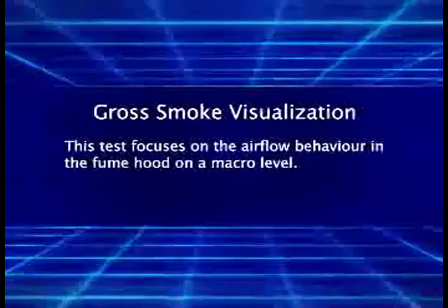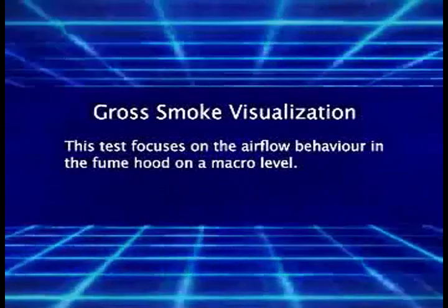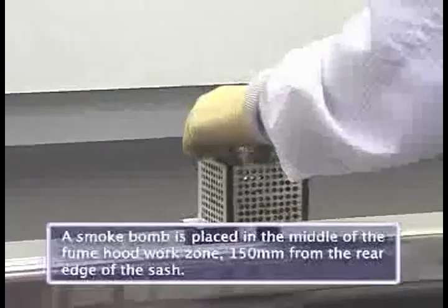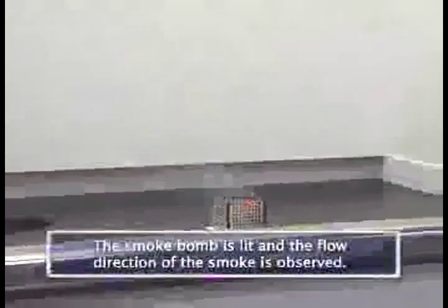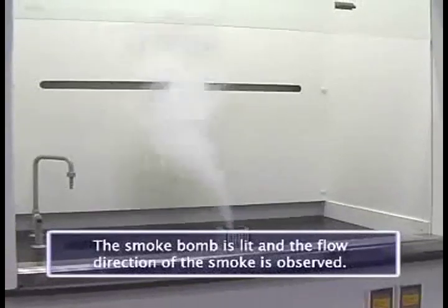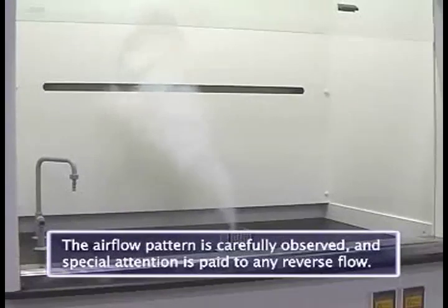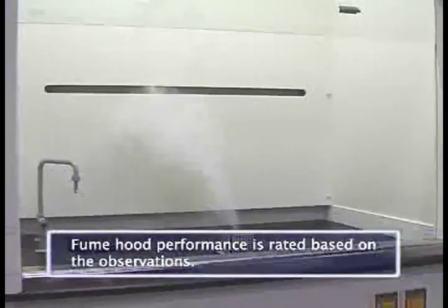The gross smoke visualization test concentrates on airflow behavior in the fume hood on a macro level. A smoke bomb is placed in the middle of the cabinet work zone and ignited. The airflow pattern and flow direction are observed, and the fume hood's performance is rated.